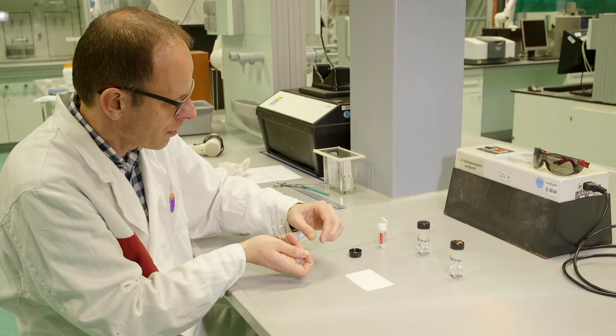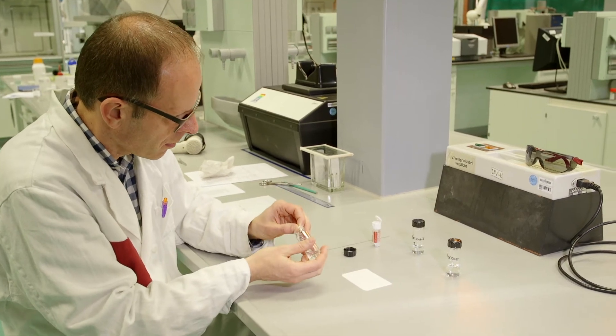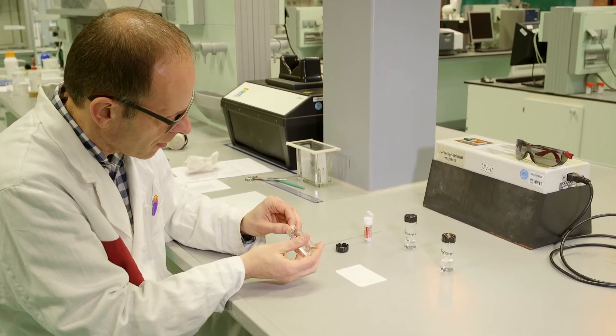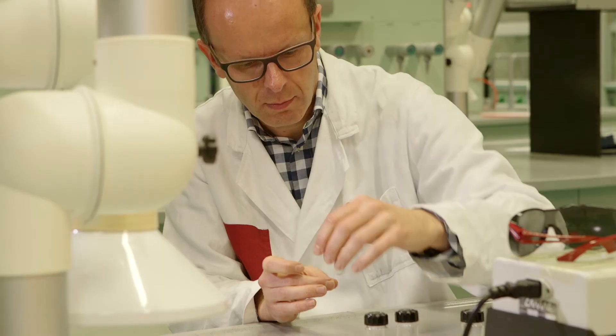A UV lamp can be used to view the sample. To identify the substances in the sample, one or more reference substances can also be applied.